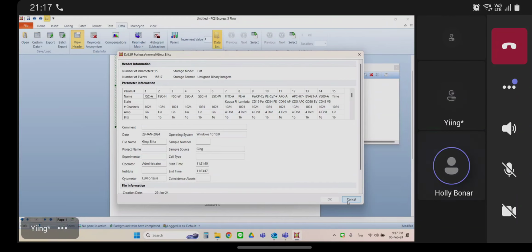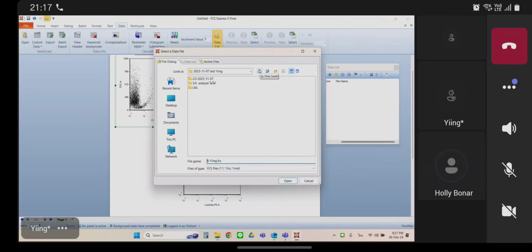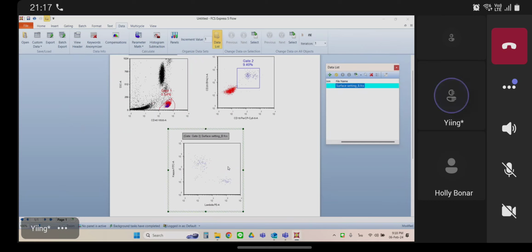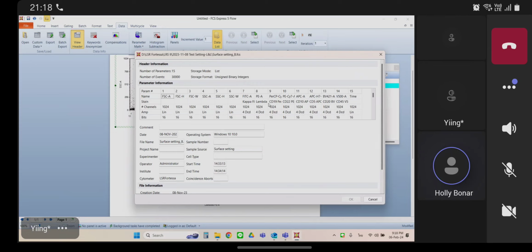Just cancel that. Delete that. Yep. Add your patient file. Now that one looks fine. And if you click on one of the plots again and go back up to view header, you'll see the parameters are numbered the same way, right? The first 6 are scatter parameters, and then 7 and 8 are kappa and lambda. So this data file looks just like the old one, and that's why it populates correctly.